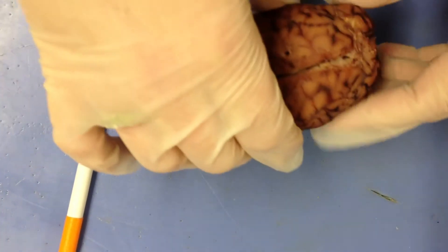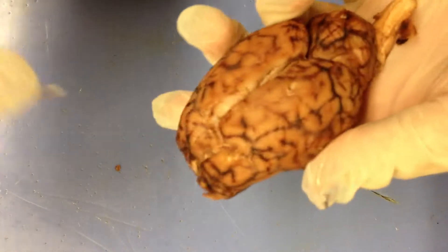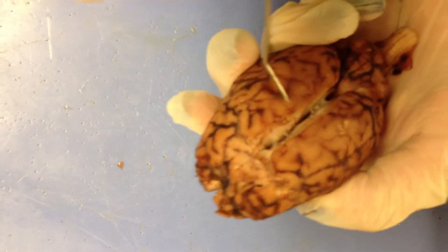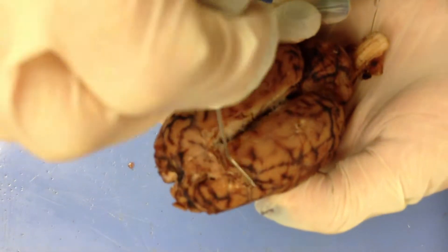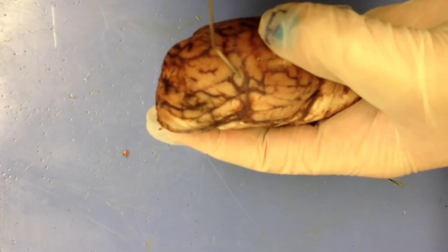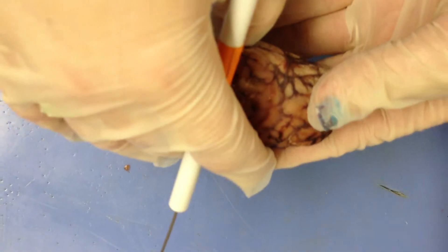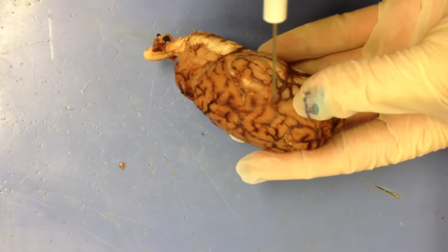Next, we'll move to the lateral view. The angular gyrus is up here. Then we have the sylvean fissure, which is right here. The insula, right here. The sylvean fissure — the posterior ramus of it — is back here.